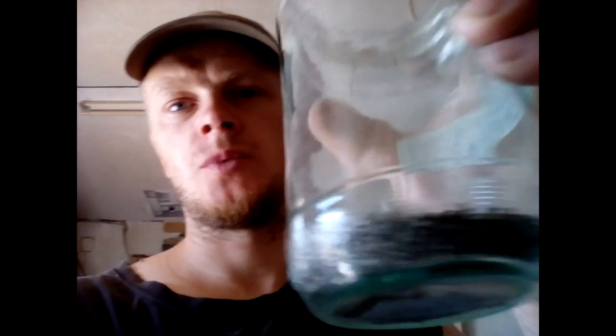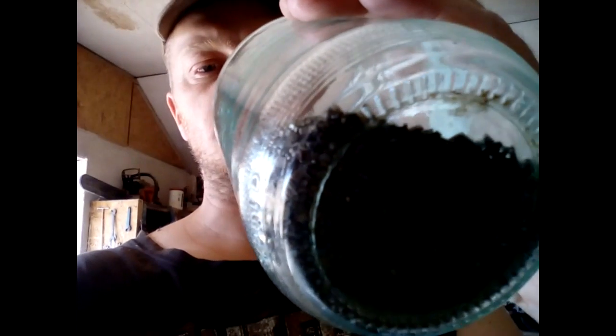Hey guys, what's up. So today we've got some new stuff for you. Look at that, this is the MLCC, Multilayer Ceramic Capacitor. What we do today is we try to recover something, some silver and palladium, maybe some gold from these MLCCs. Here I got about 280 grams, almost 300 grams.